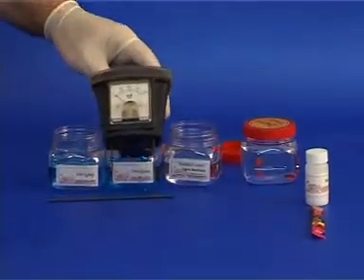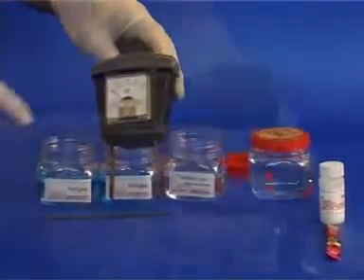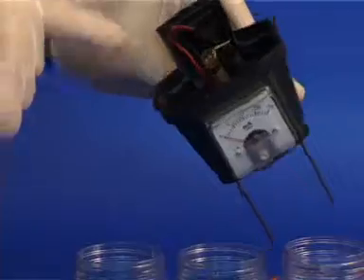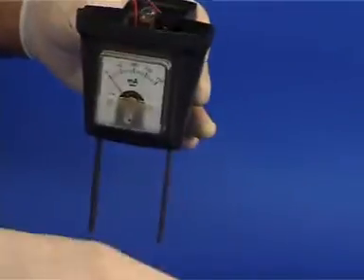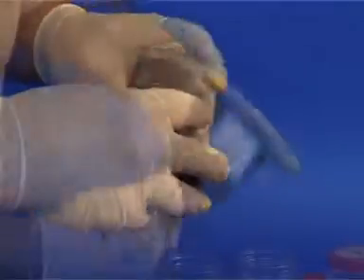The alternative conductivity device is also equipped with an ammeter. Inside this device we also have a bulb, a battery, and a spare bulb. Let us replace the cover and polish the electrodes with sandpaper.